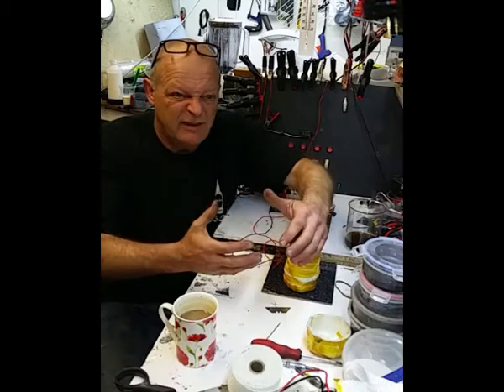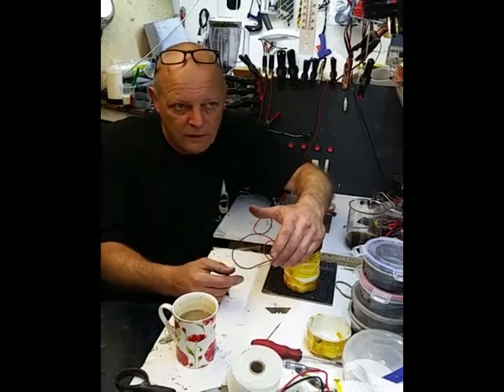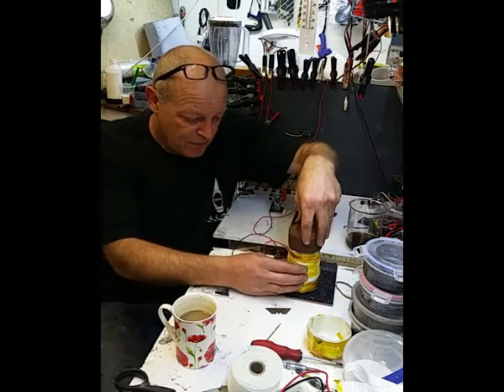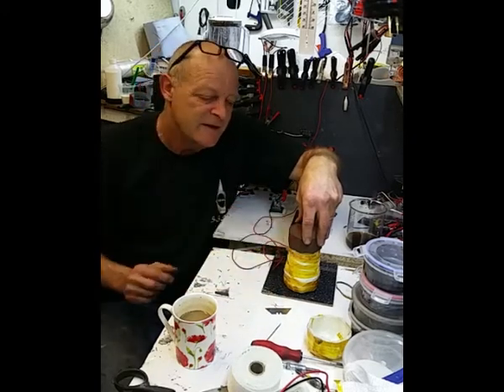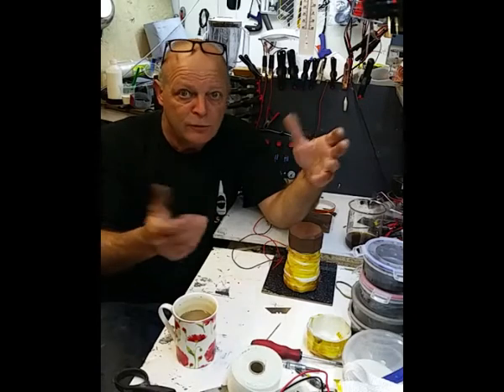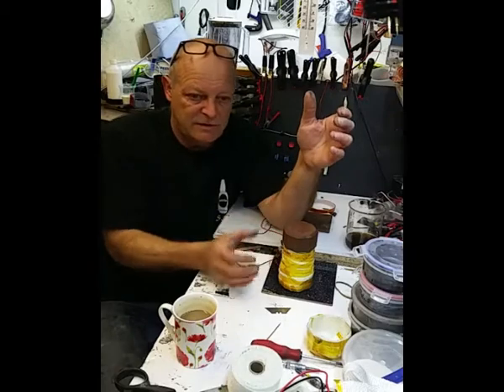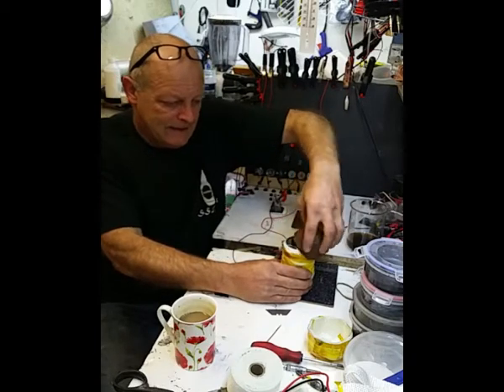Because this barrier might keep a lot of the heat in, and for the same voltage and current, we might get a higher temperature, because we need to be at like 180, 200 degrees, somewhere around there. And we got, what, 108 in air. So I've made this. It's a bit cobbled together, I know that. But this is just to test this theory. What I would do is get some thermal block, the stuff you line kilns with. I'd carve a circle out of it and just drop that in. That's the way I would do it. So it's like a mini kiln as well, if you like. So yeah, that's the theory.